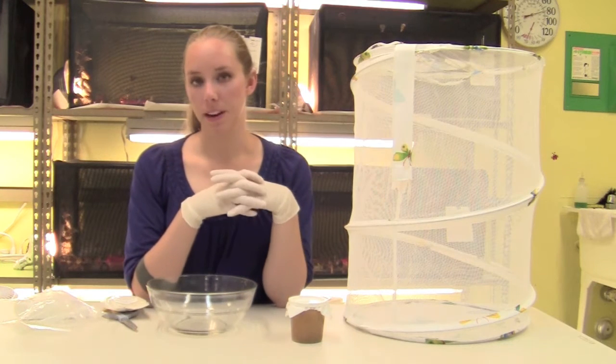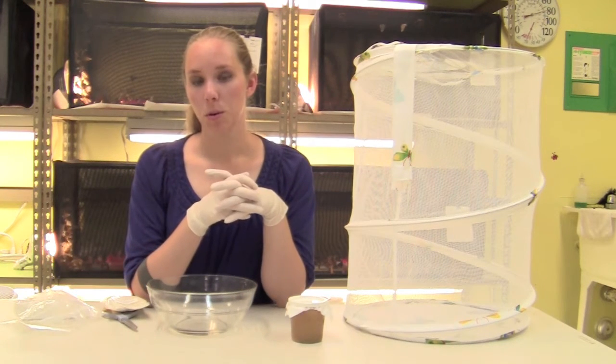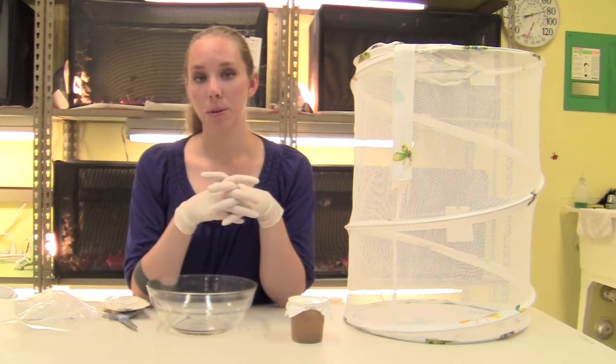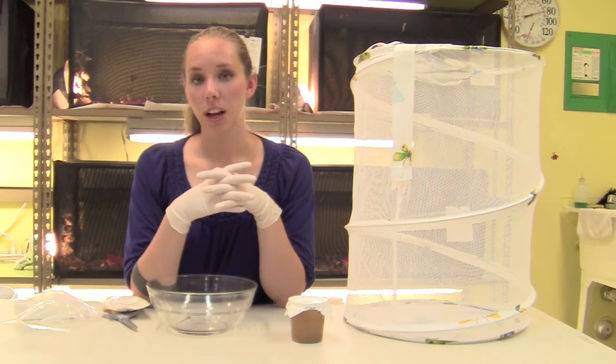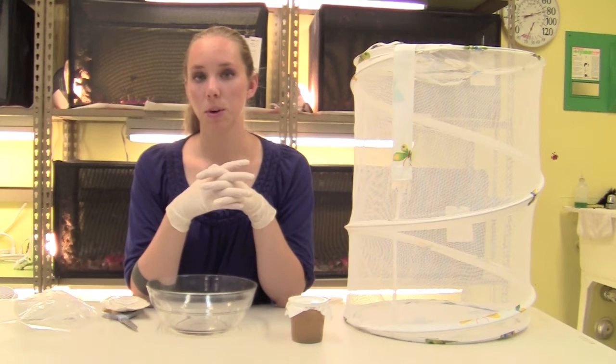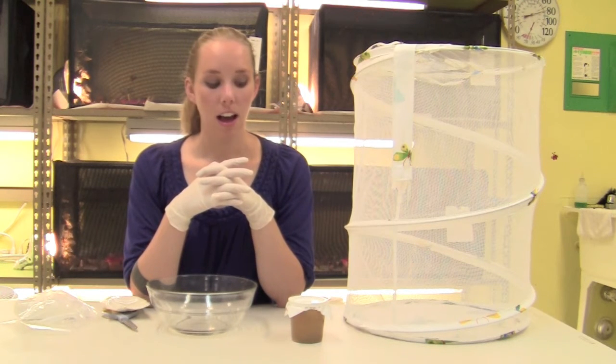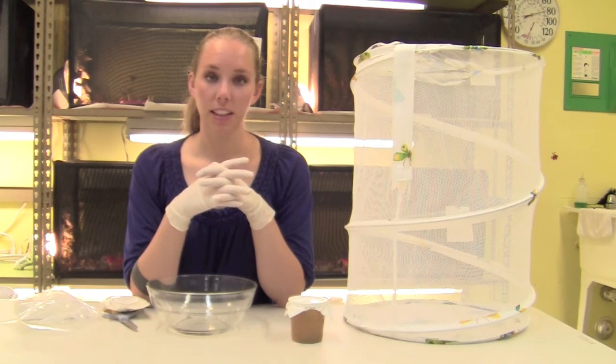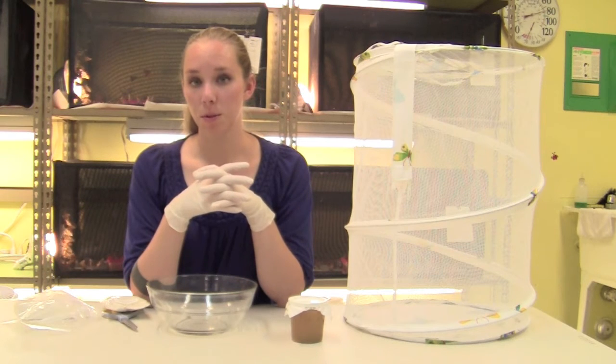Your larvae might appear dead when they arrive. This can be normal. When larvae are molting, they might not move for a few days. You should allow a couple days to observe them and see if they're molting before assuming that they're dead. After a day or two, you can check and see if they've moved or if there's any food that has been eaten.